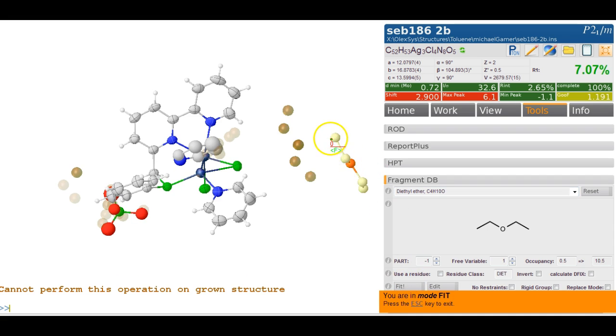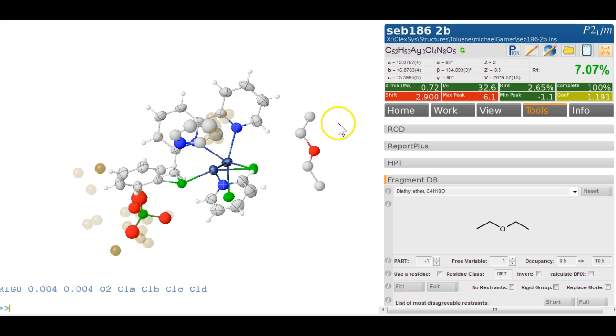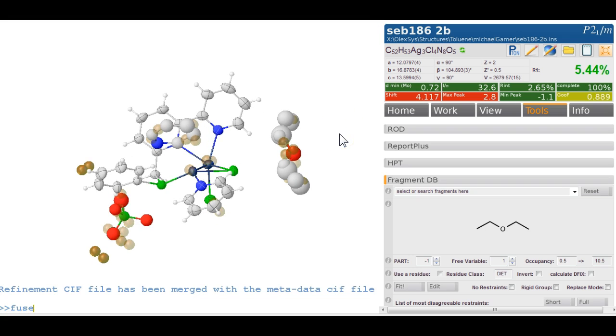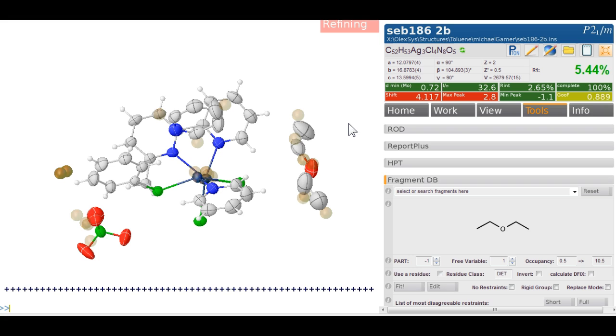We fit it and start on the oxygen in this case. So 0 and 1 here, and then we nail this one here, and then the last one, this one here. And that covers those peaks quite nicely. And again, the occupancy should be 1/2 and part -1. And let's refine this. And this is now the grown version of it. So if you go fuse, then we see the single version of it. And I would suggest what we do now, be bold, type anis, refine everything anisotropically, Control R, and see where we get to.